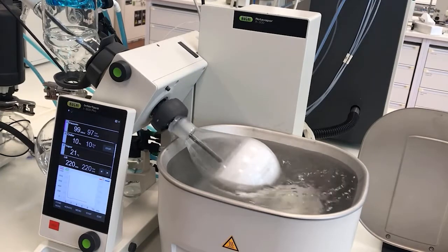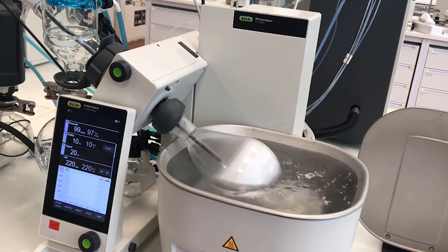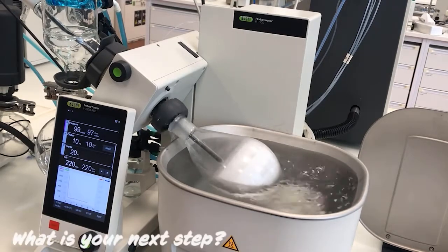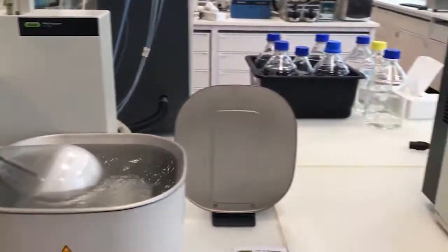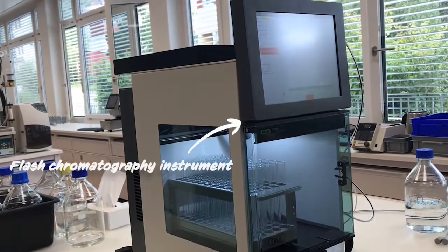If for your sample you need to concentrate, meaning that you need to have some solvent left in the flask, then you'll have to stop the process before complete dryness. In order to decide whether you should go for concentration or drying, you need to know what your next step is. For example, if you need to do a purification with the liquid injection of your sample in the chromatography system, then you would need to perform a concentration.